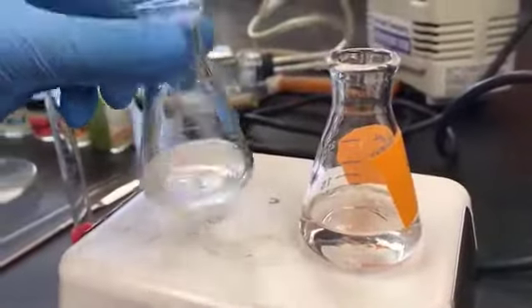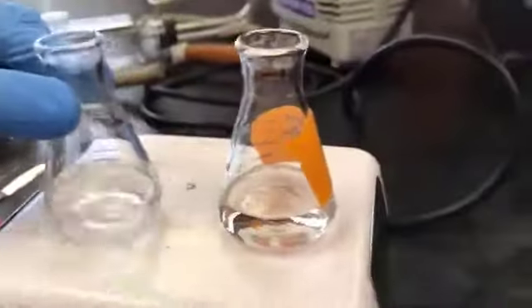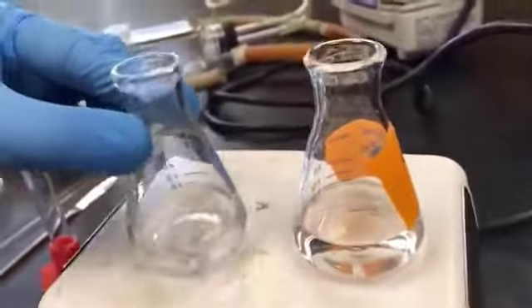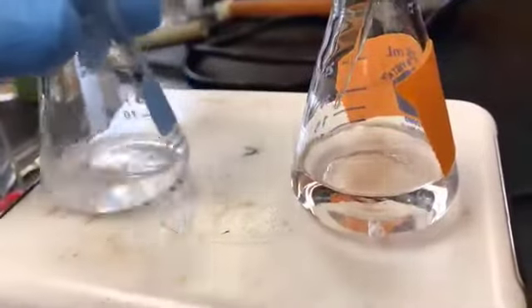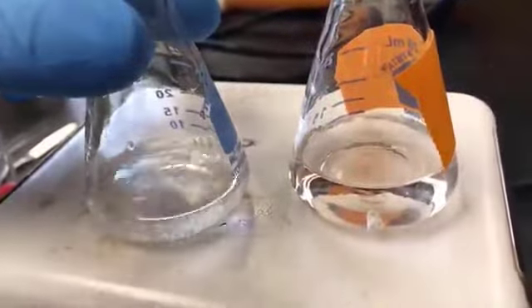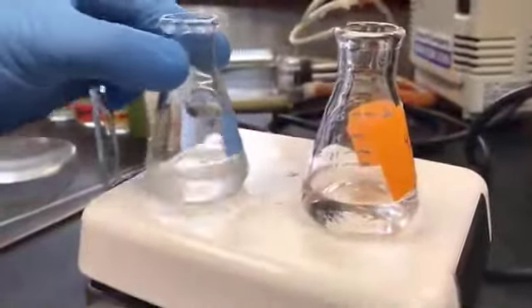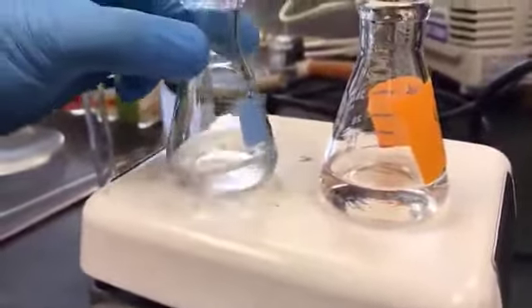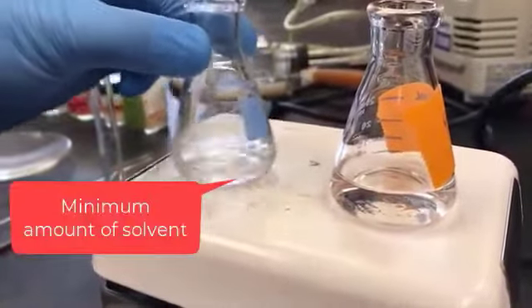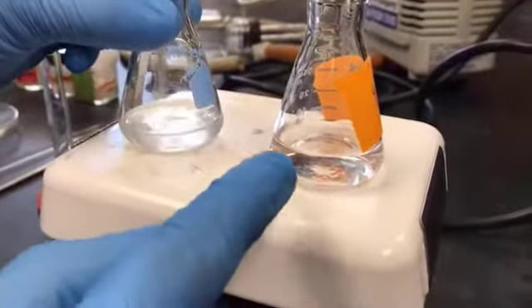See, now after enough swirling, it did not dissolve completely. So I'm going to add 0.5 milliliter more. Maybe some of the solvent has evaporated while swirling, so with that it will now be 4.5 milliliters total. I've added about 4.5 milliliters. Some of it evaporated as well, so it will come down to actually about 4, but that's the minimum I tried. So that's the minimum amount, and you can see the sulfanilamide is now completely dissolved in that much, right? And the solvent is still boiling.